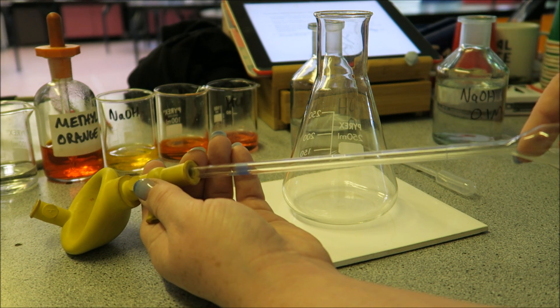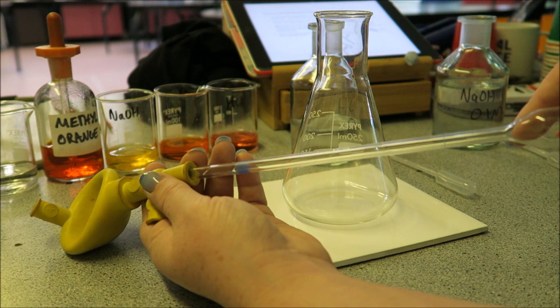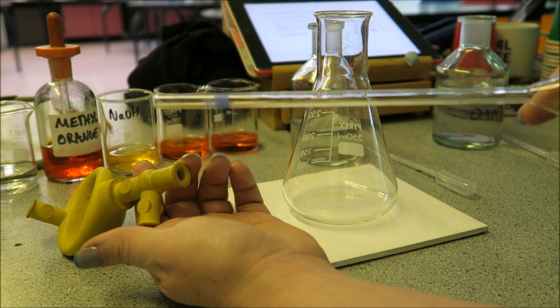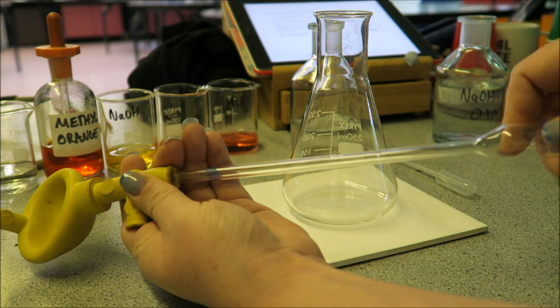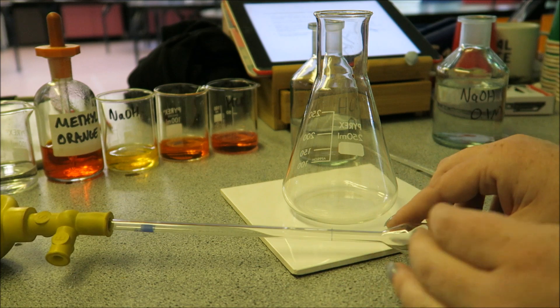I take chemistry for a reason—I don't like the sight of blood. So we need to pop that in there, just going around is a nice way to get it in there quite securely.